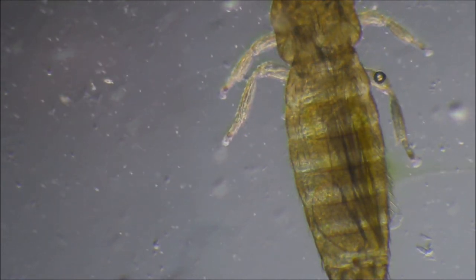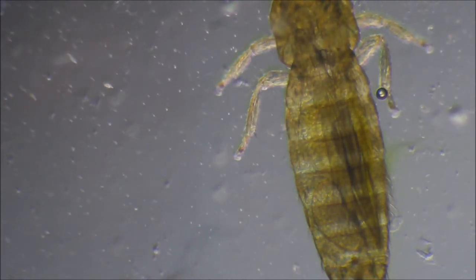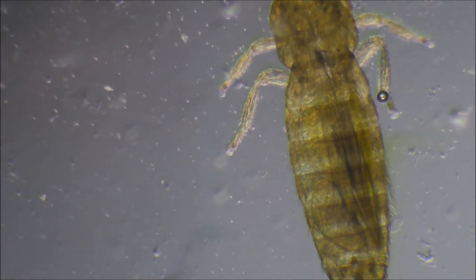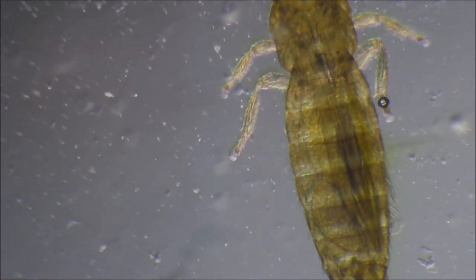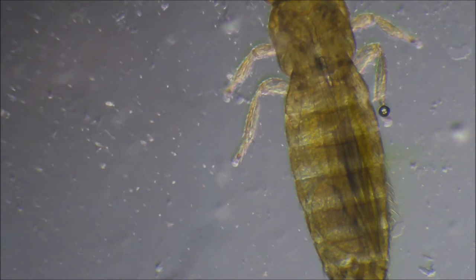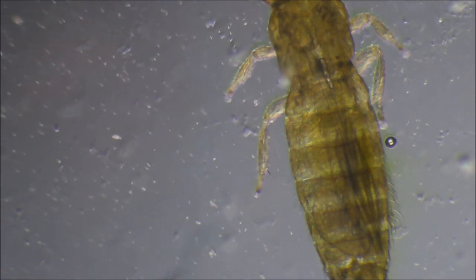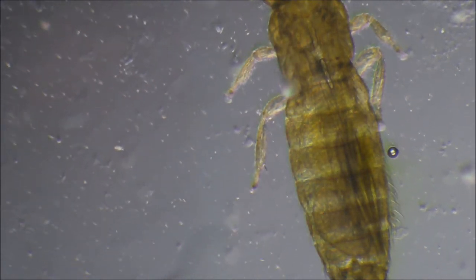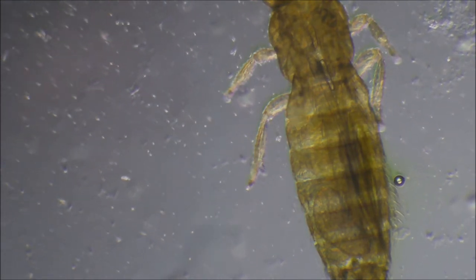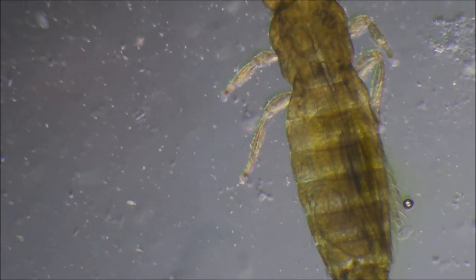Now you'll see the potassium salts and fatty acids that have just come through — the liquid has just been put under the cover glass. You can see how long it's going to take for it to die. That's the first experiment, and there are three more to go.